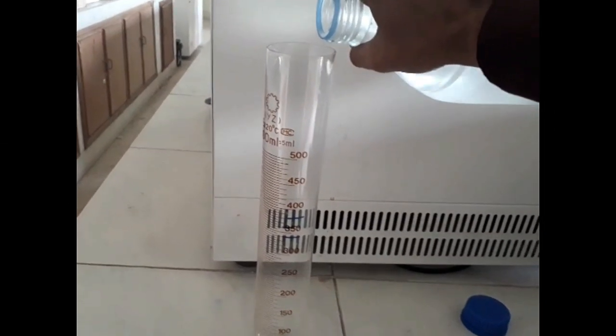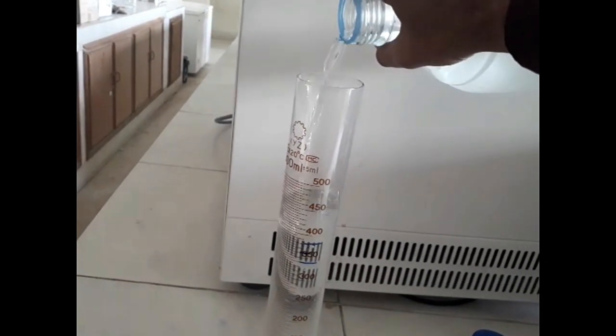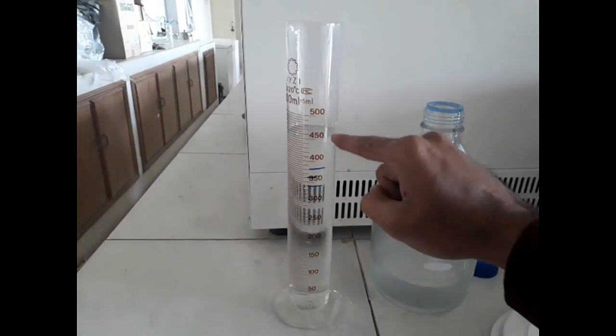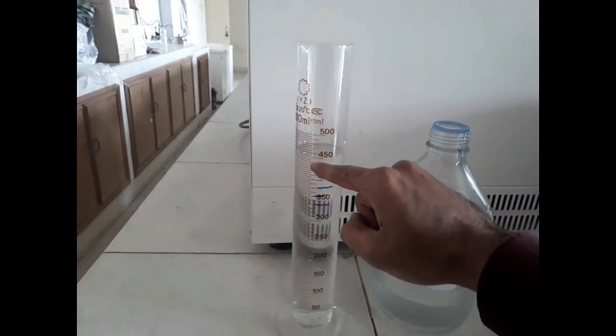First, take 450 ml of distilled water in a graduated cylinder. Why 450 ml of distilled water?